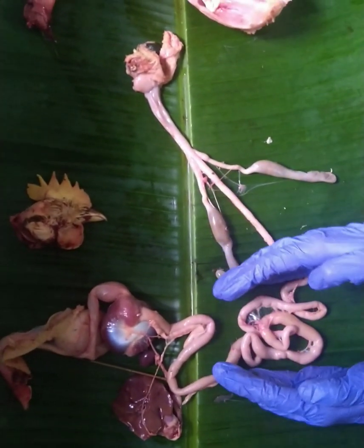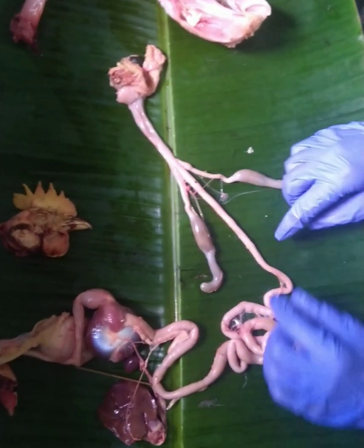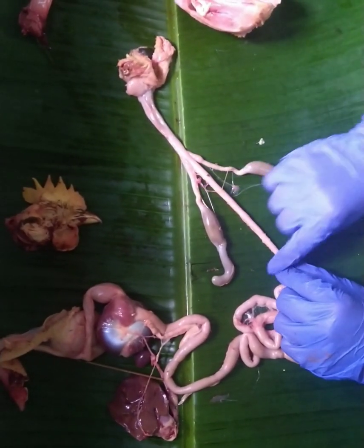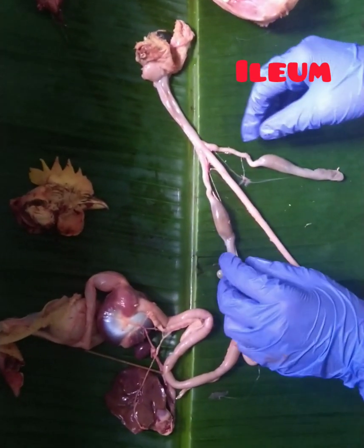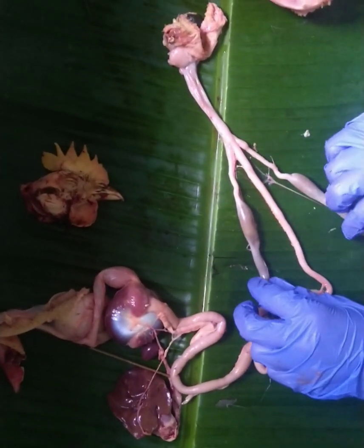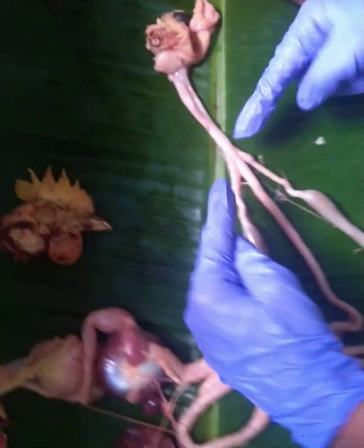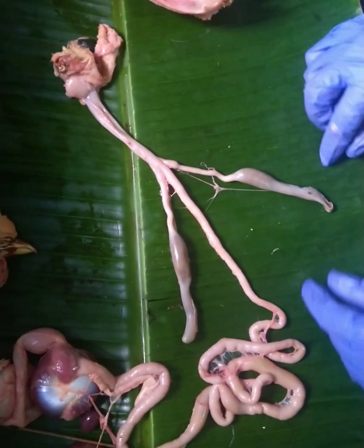The next part of the small intestine is the jejunum, which as you can see is a supercoiled structure. It later extends into a straight portion known as the ileum. After the ileum we have the start of the large intestine, whose first part consists of these two prominent lateral blind sacs known as the cecum.